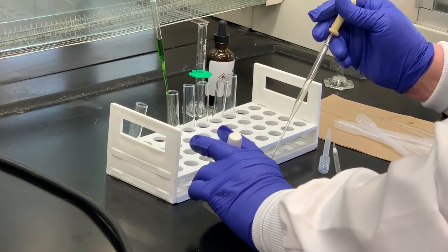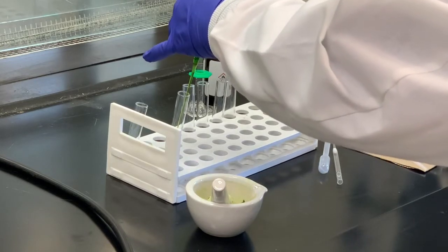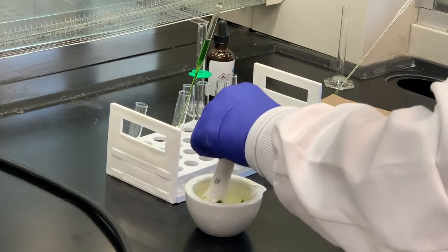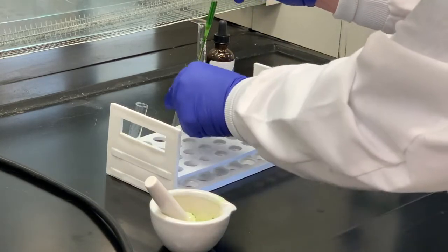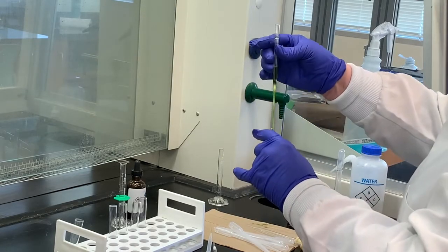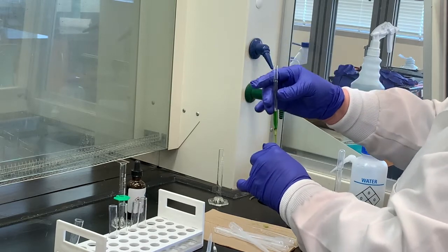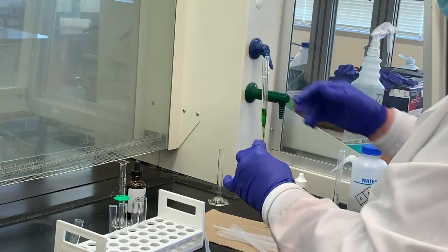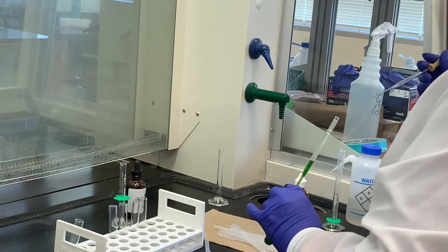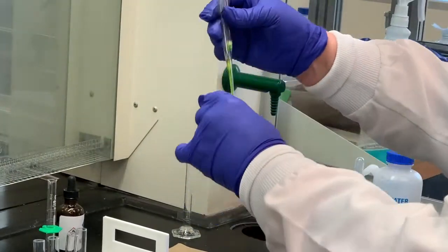There are several different techniques and different solvents you can use. It's best if your spinach is also dry — if it's wet, water can sometimes make it more of a gelatinous type material. I think I've got as much as I can, so I'm going to let this drain. I may need to filter this through another cotton plug. It's going awfully slow, so what I'll do is use another cotton plug and remove the liquid from one and pour it into the other to help facilitate it.